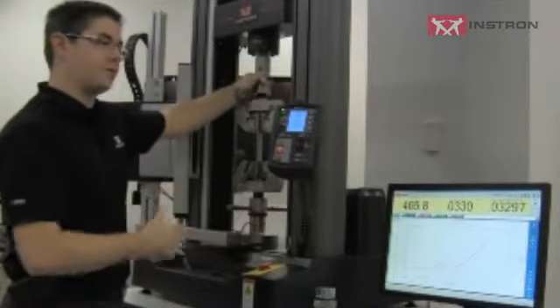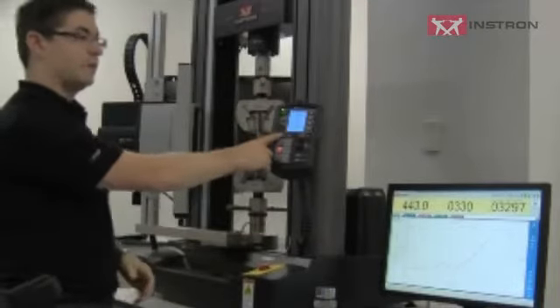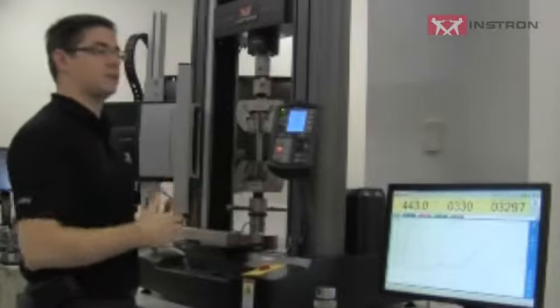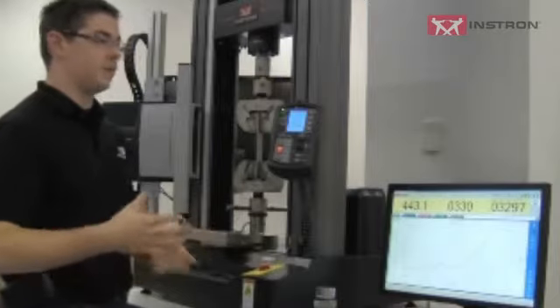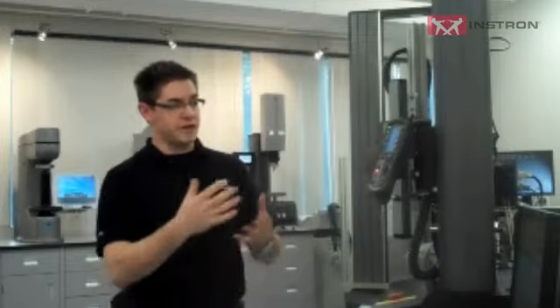So now that we're up at 500 pounds, I can tighten the check nuts by hand. Now I'm going to enable specimen protect. This feature allows the crosshead to reduce the stress on the specimen automatically. In this case, I've told it to stay within plus or minus 10 pounds. So it'll go from 500 down to, in this case, 7 or 8. It's still active.